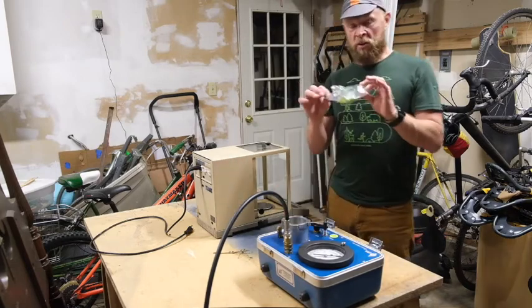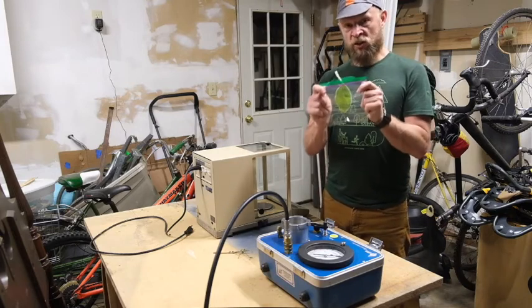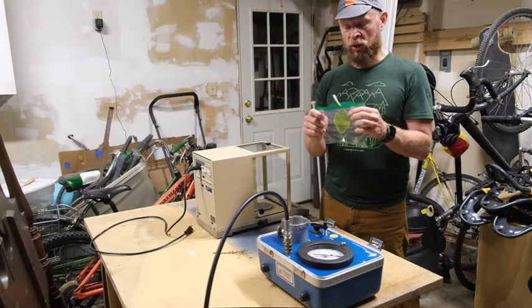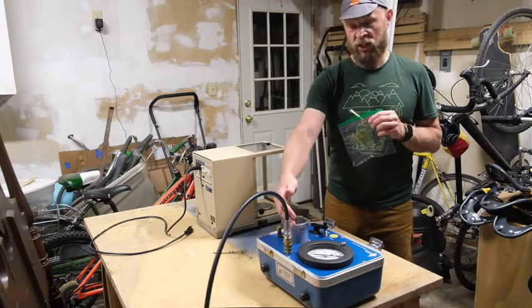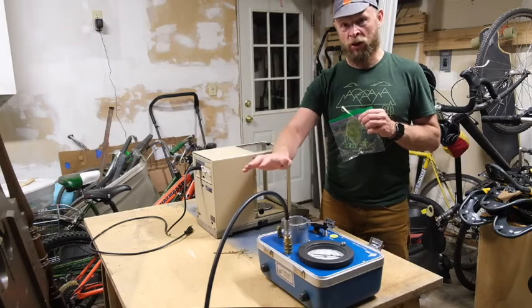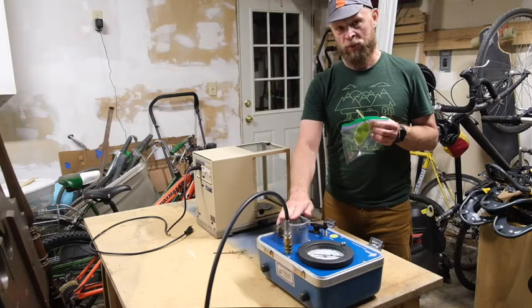There are 2 reasons for the plastic bag. One is, we're going to measure this repeatedly, and we want really accurate data to get a good pressure volume curve. When we put it in the chamber to measure water potential, the air from the compressed nitrogen tank coming into the chamber is completely dry. There's really almost no moisture at all in there. That can dry out the leaf while it's in the chamber.